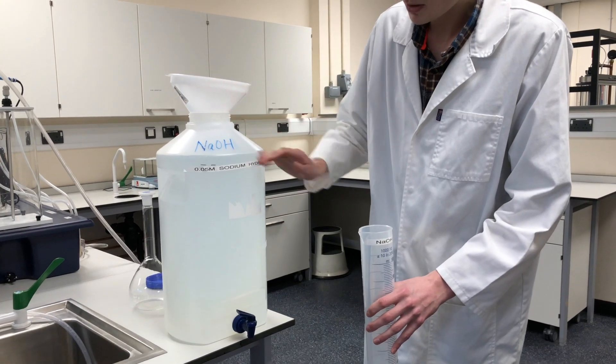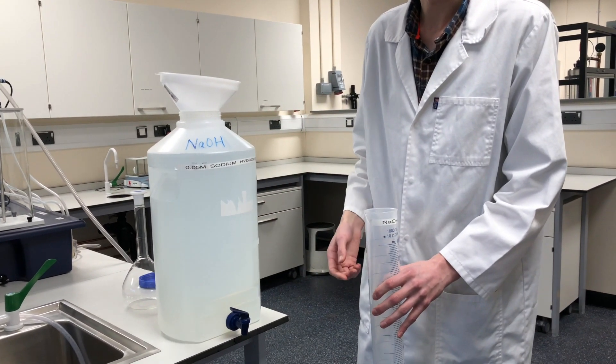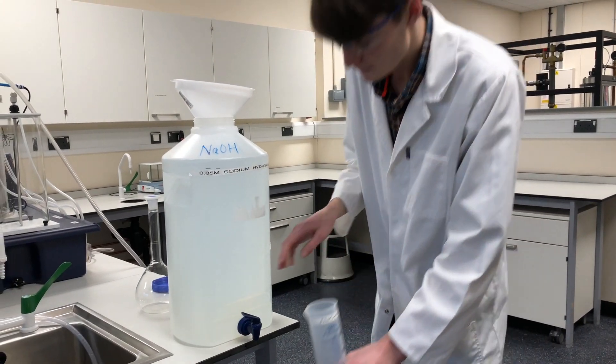The solution has been added at the top, but to make sure it's consistent concentration all the way through, we need to circulate the fluid a few more times.